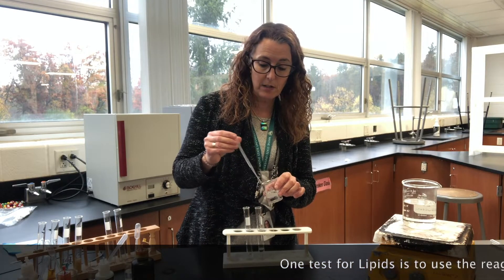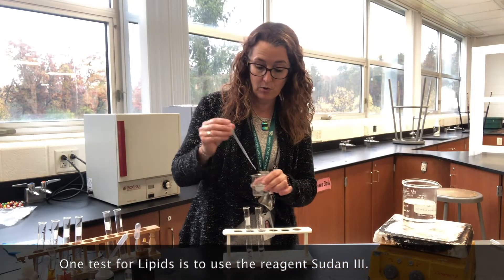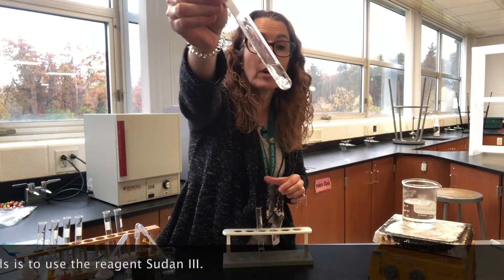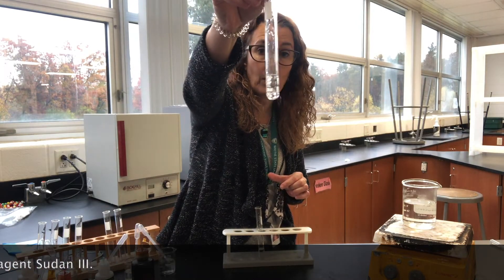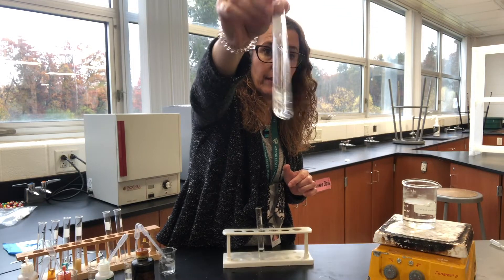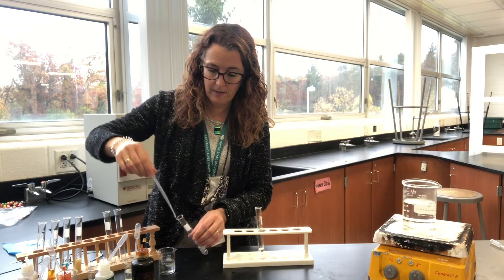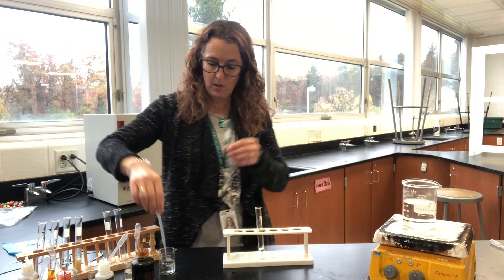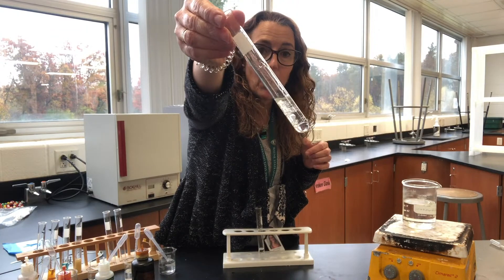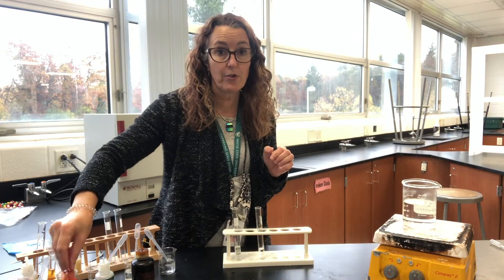For this test we're going to use a reagent called Sudan 3. I'm going to add water to my oil as well. When you mix them together you get these globs of water. When you add oil and water together you get these blobs. Sudan 3 is red.